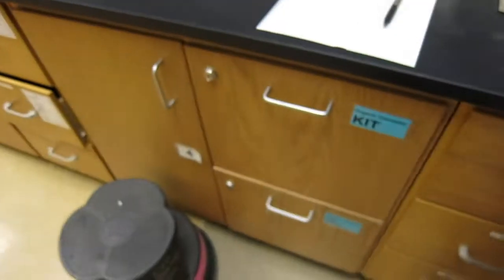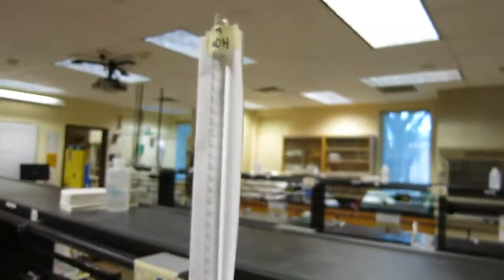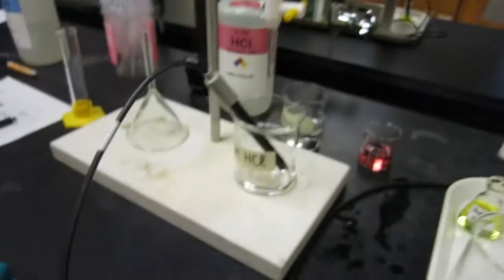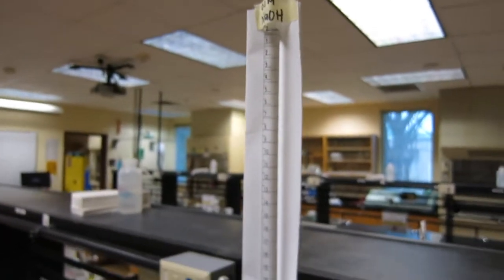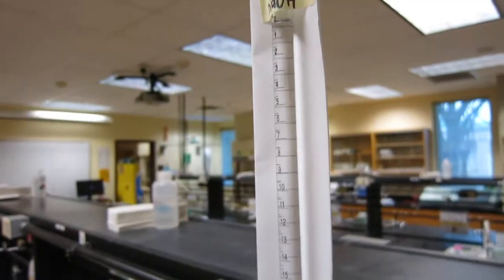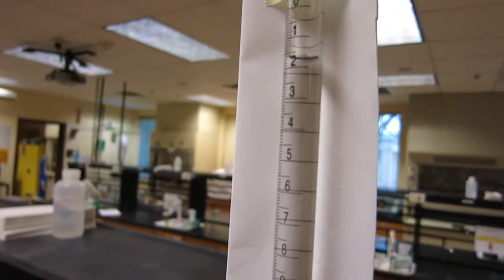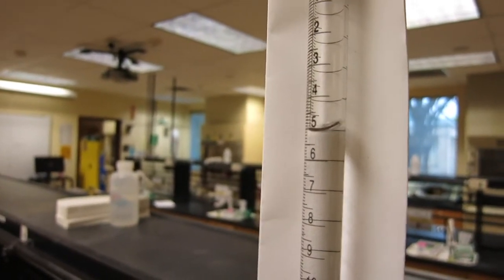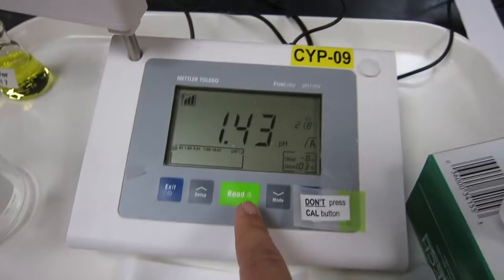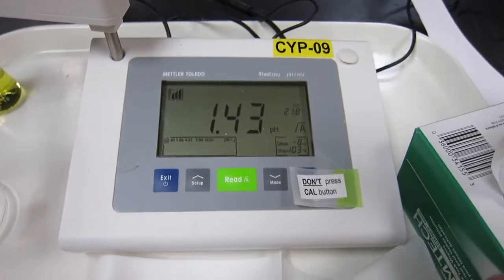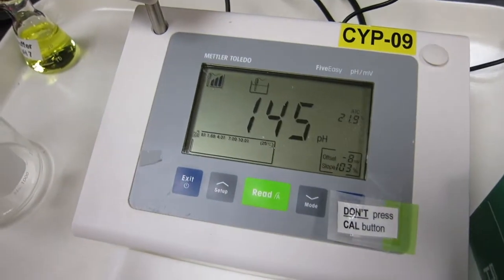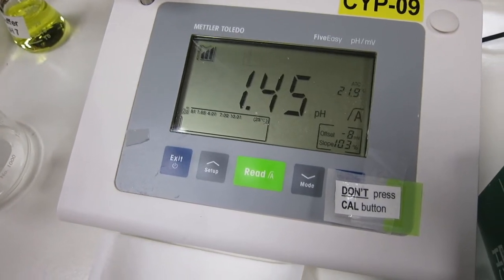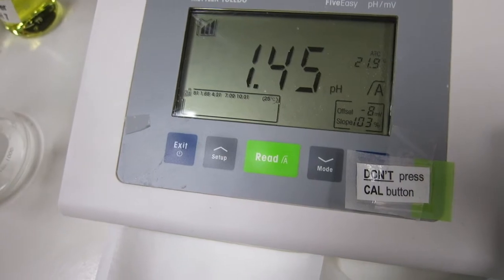We're going to go on the next one which is 5 mL. We keep the probe in there, so we're going to dispense and release 5 mL. Good, perfect. Now we're going to read this again. I'm going to press read. It's increased to 1.45.